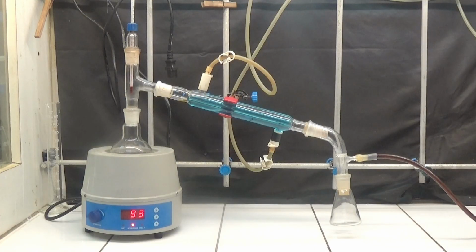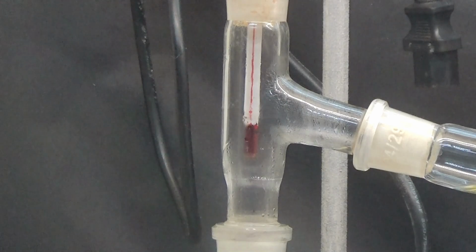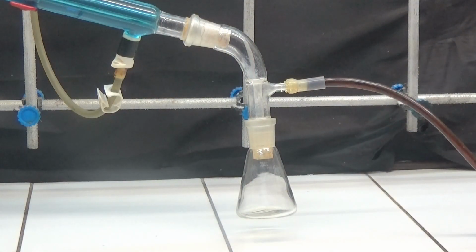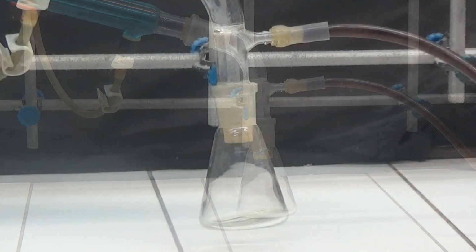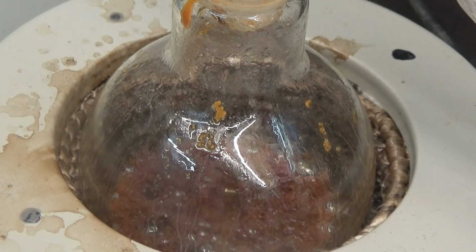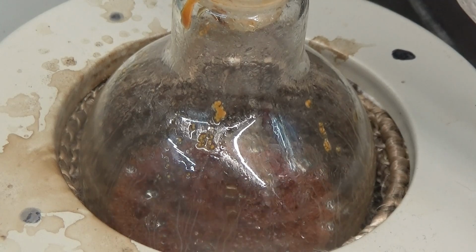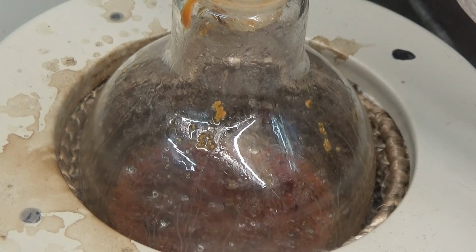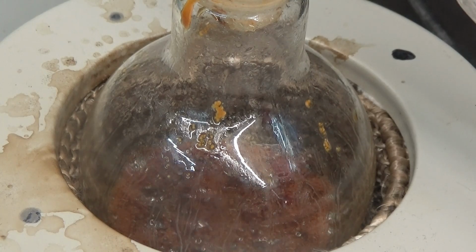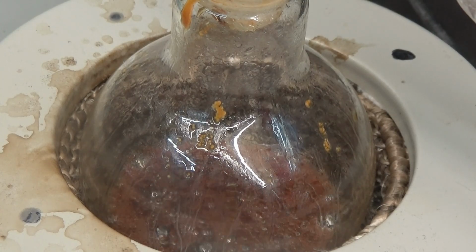After refluxing, set up a distillation apparatus and distill the contents at low pressure and low temperature to remove all the ethanol. Little distilled ethanol was observed in the distillation. Its spontaneous evaporation by the system at low pressure is possible. The distillation is stopped when it is observed that the distillation residue is dark, very thick and does not distill ethanol.